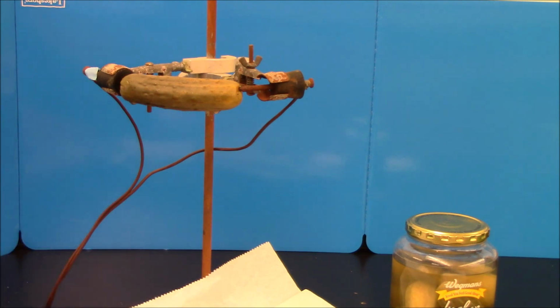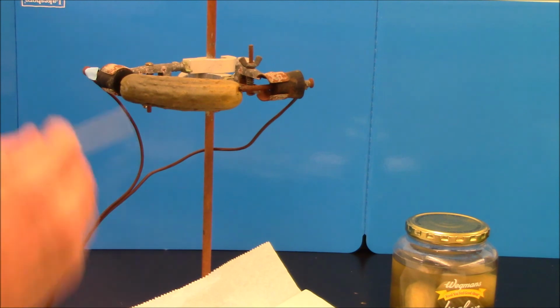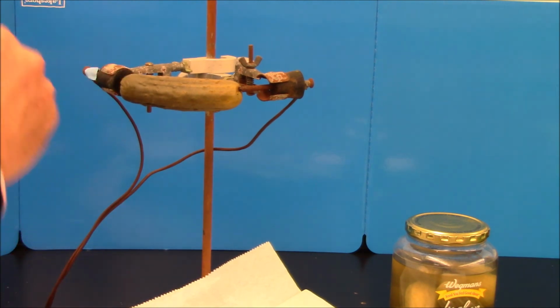The yellow color comes from the sodium ions. Sodium ions, when they're energized, produce yellow-orange light. Sometimes that's used in making some light bulbs. So if you see bright yellow lights, sometimes they have sodium vapor in them. And sodium ions are positive, so this must be the negative end of my circuit, because number one rule of electricity, opposites attract.